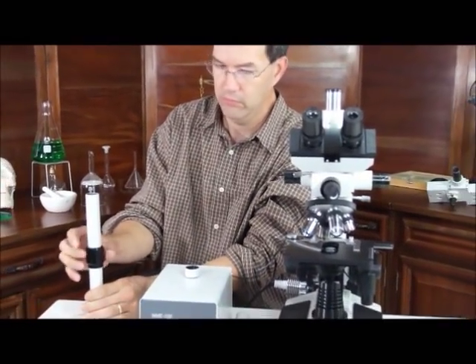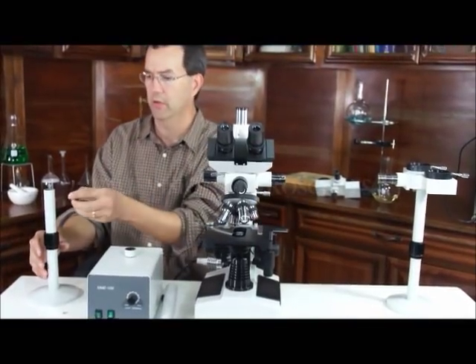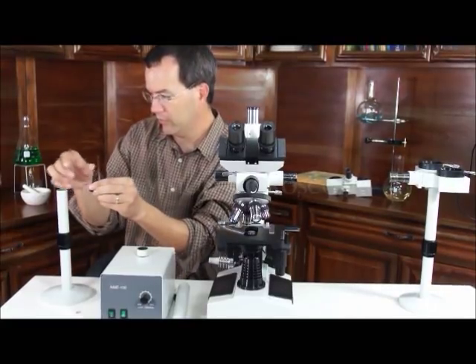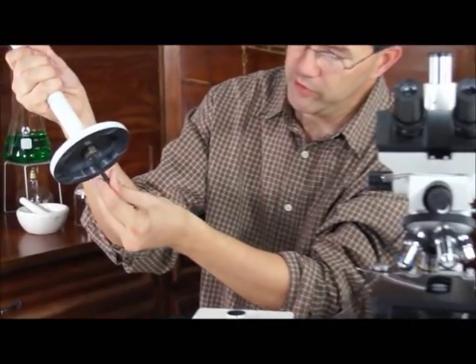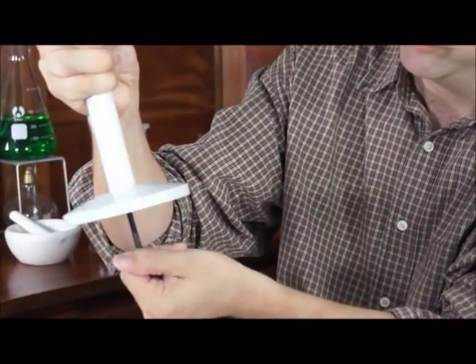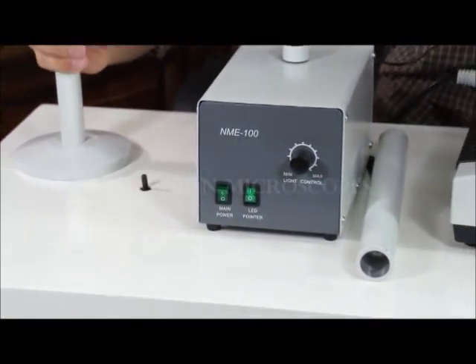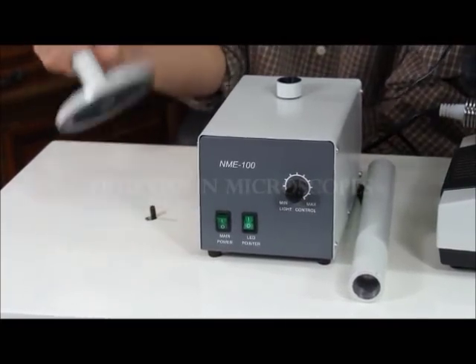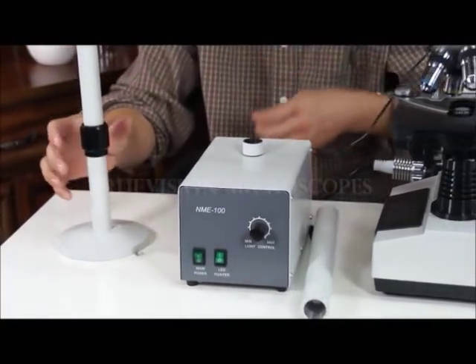At this point it's ready — ready to assemble. There is an Allen head socket screw for the bottom. This bolts it to the table. So you put the Allen head from below and just tighten it up.